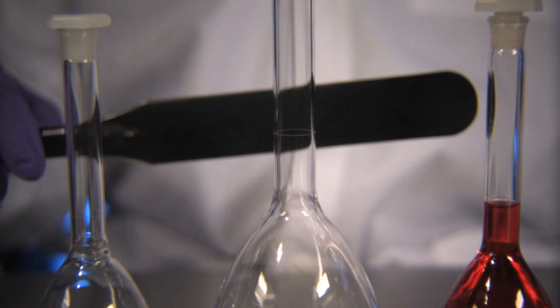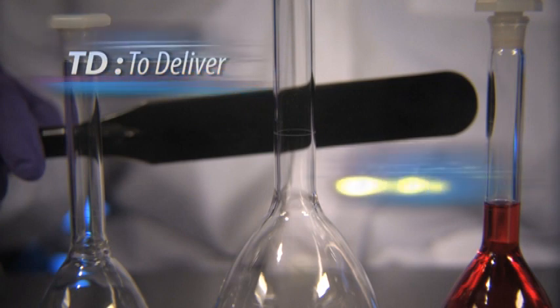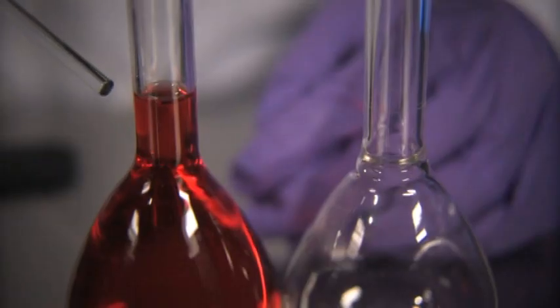Most flasks will have one calibration mark etched around the neck and will note they are calibrated to deliver a certain amount, marked with a TD, or to contain a certain amount, marked with a TC. Some flasks have both calibration marks, TC and TD.